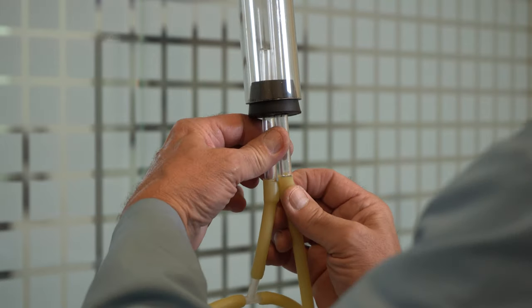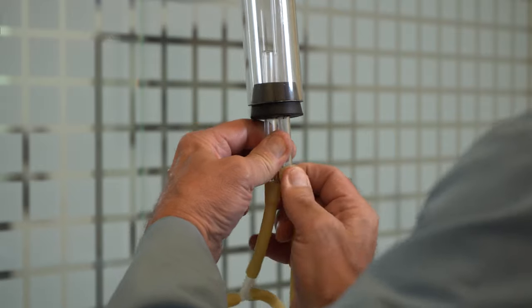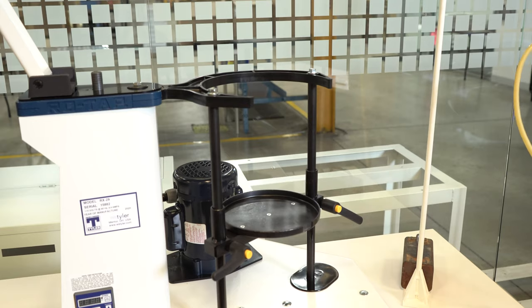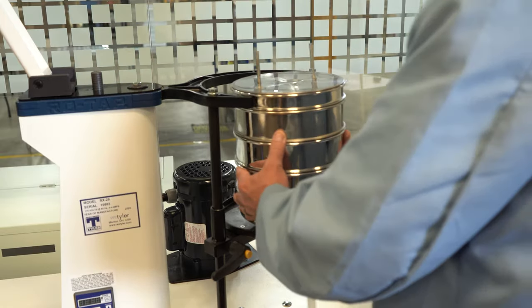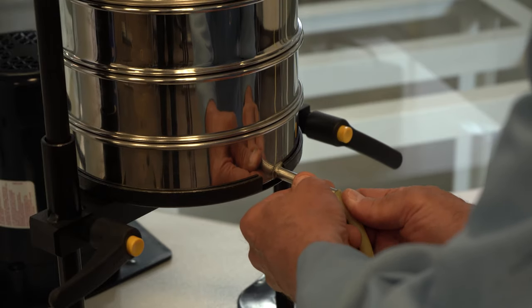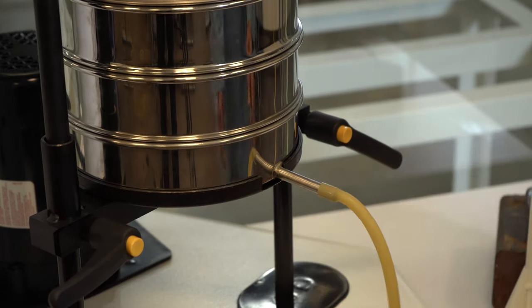Step 7. The longest rubber tube attaches over the end of the higher outlet on the flow meter assembly. Step 8. Place the sieve stack in the shaker on top of the bottom pan. Attach the outlet tube to the steel tube on the bottom pan.